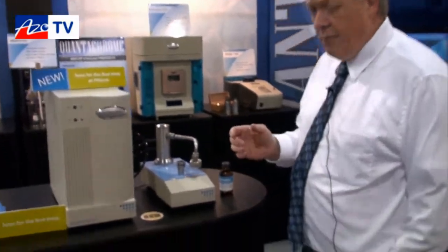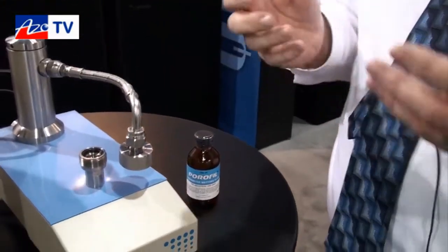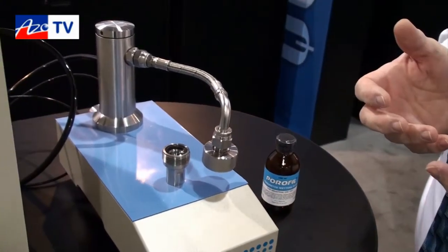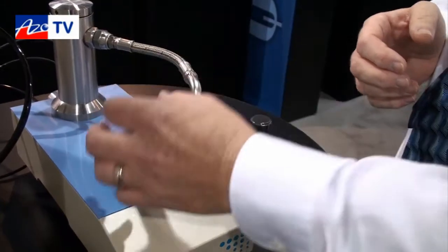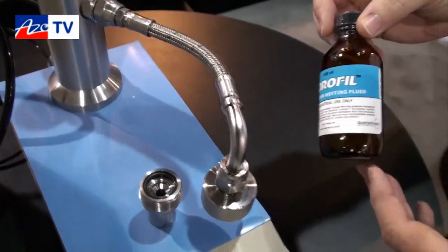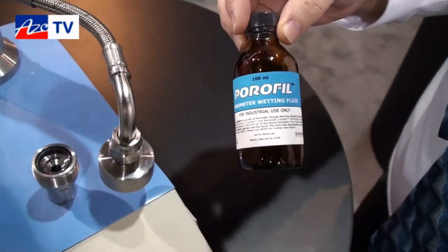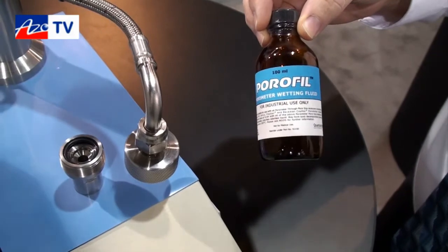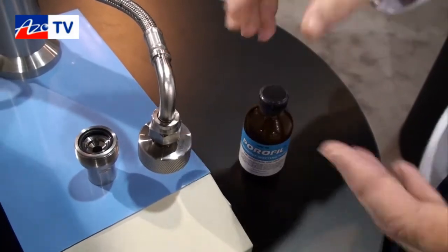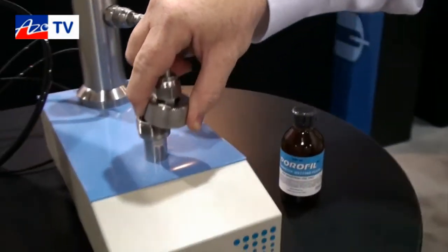The technique is very simple. The sample is cut as a disk. For standard filters, we have standard sample holders that take, for example, 47 millimeter diameter filters. The sample is cut, if it's not already pre-cut, and placed in the sample holder. Then it's wet with a special fluorocarbon liquid which will wet even PTFE, but it won't swell cellulosic material.